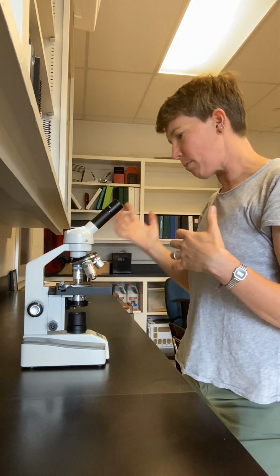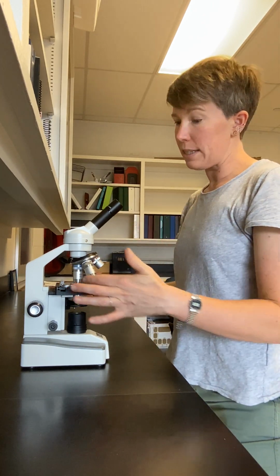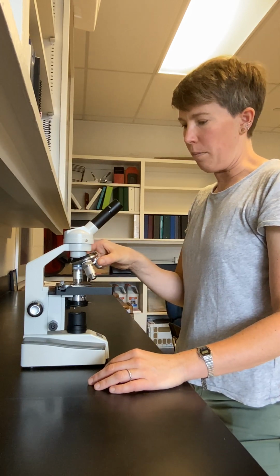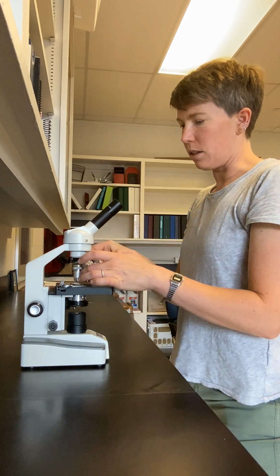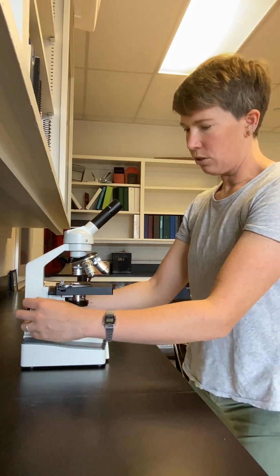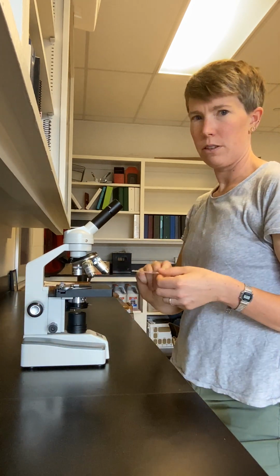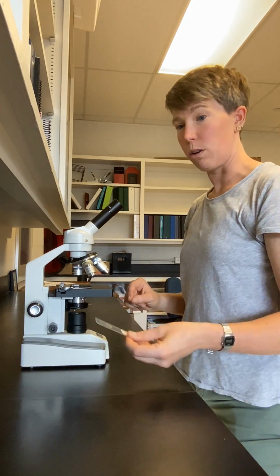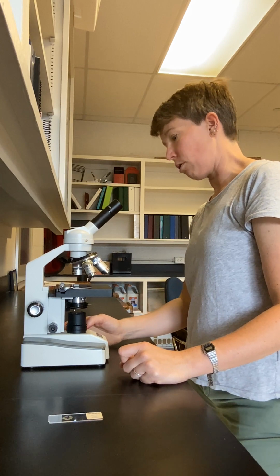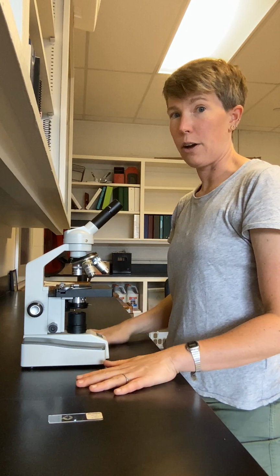Okay, so I've looked at my sample under all three powers of the microscope. In order to release the sample from the stage, first you need to rotate the objective lens, the low-powered objective lens, back so it's pointed down at the sample. Then you want to lower the stage. Then you can take off the slide and exchange it for another one, or if you're done for the day, you can turn off the scope and rotate the light intensity all the way down. And that is how you use the microscope.